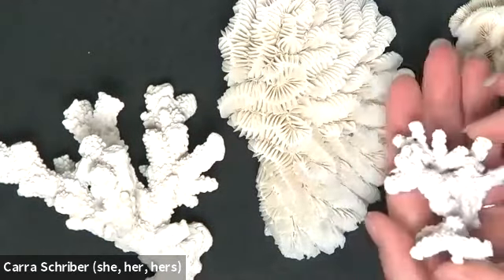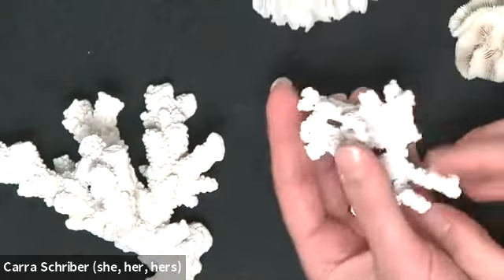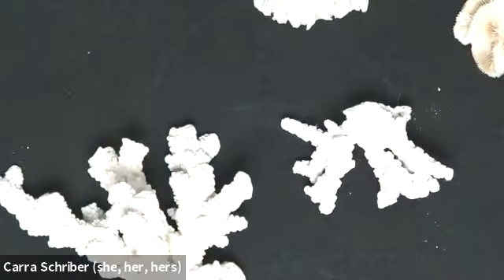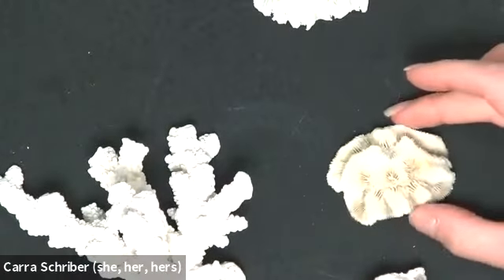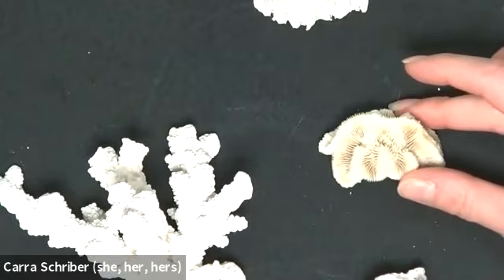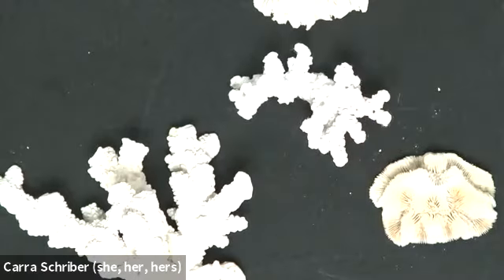So some of the coral structures kind of remind me of some of the fungi we looked at last week, right? The coral fungi. So they can create these like long kind of stocky forms. And then we also have some kind of like brain-like structures. Okay, and so all the holes you're seeing here are where the little polyps would be if this were live coral. I also have this really crazy coral sample.